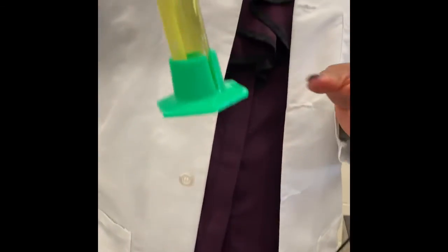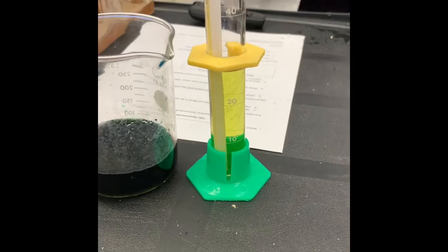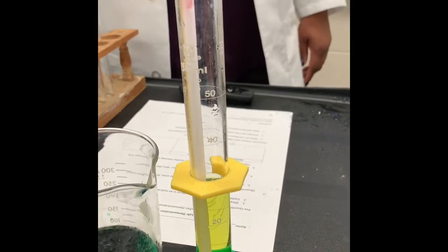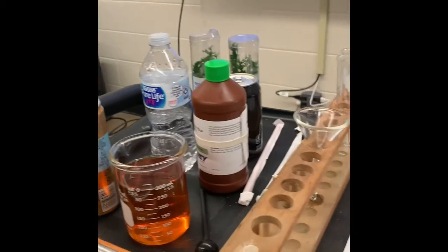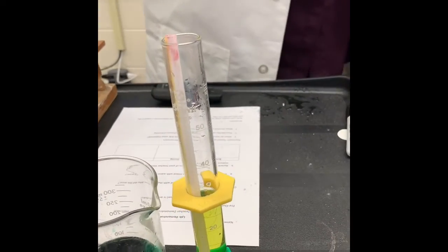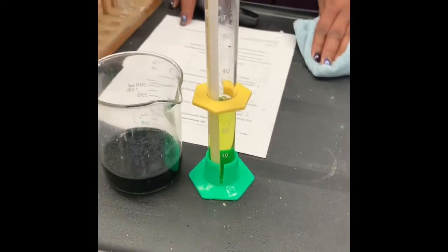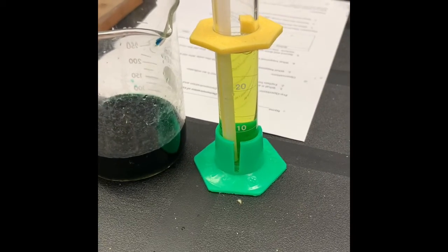So why did it change colors from the dark blue to the yellow? It went from blue to green to yellow. And I wonder why that occurred. Why do you think that occurred? So here we noticed that there was carbonated water. Carbon was put into here. And here I'm breathing out into the water. What am I breathing out into the water? I am breathing out carbon dioxide. And carbon dioxide is something that I am expelling.